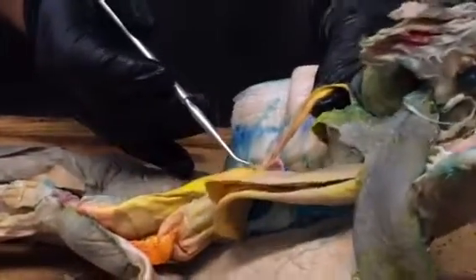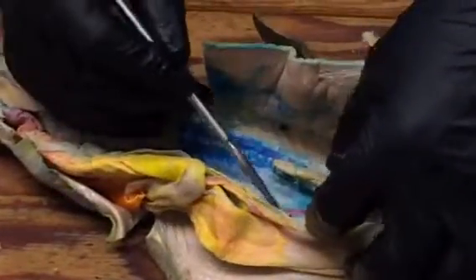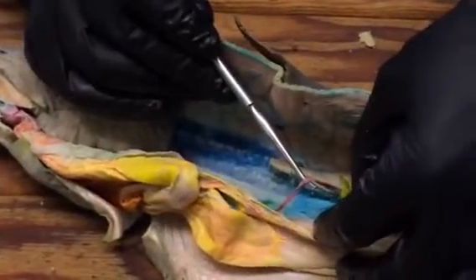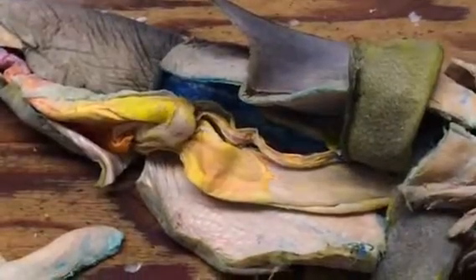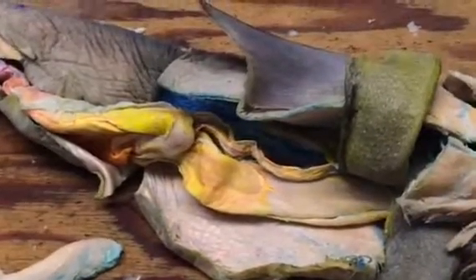So there's the hepatic part, there's the gastric part, and they're both coming from here, from the celiac artery, which is this one here that's popping into that region. Okay, so that's the celiac.